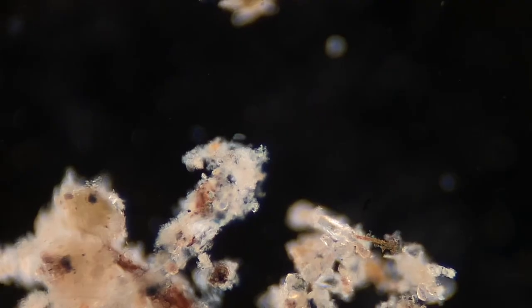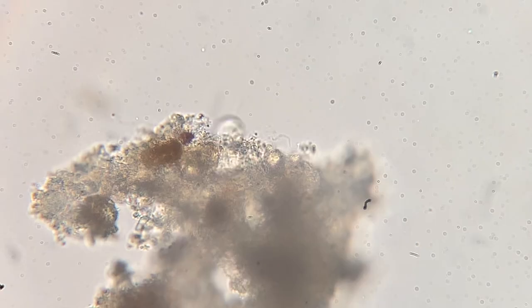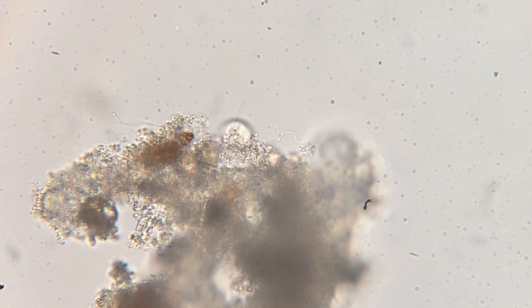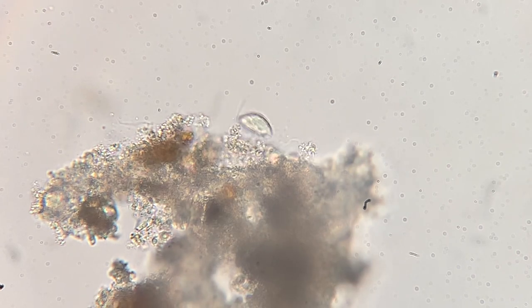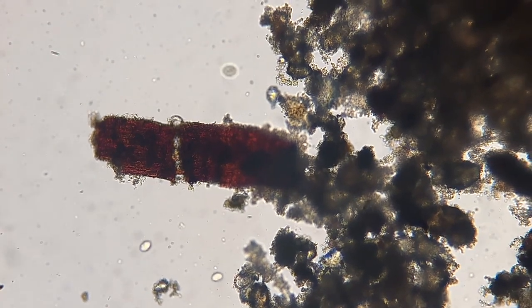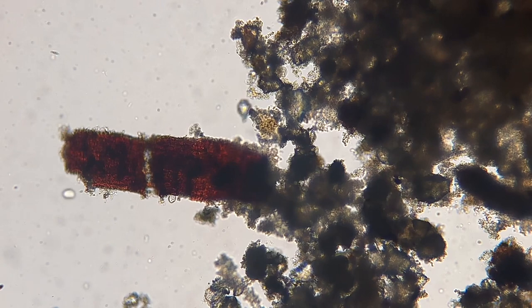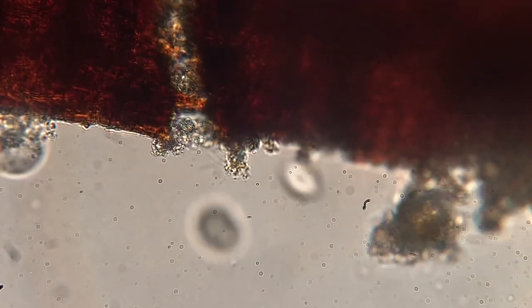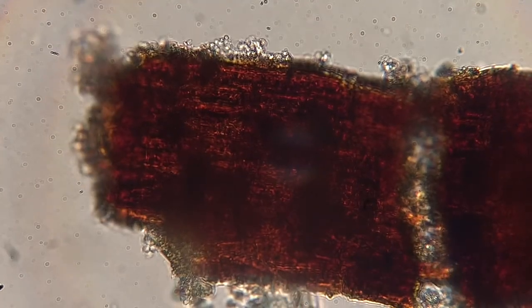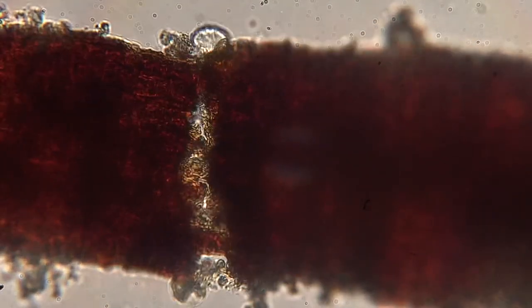Let's go ahead and look at some things that are a little bit smaller. These guys are probably in the same family or group as the spirotrichs — they might even be a different subspecies. They have a very similar shape, and most of their cilia are underneath their body, which they use to swim but also crawl around. There were a bunch of them that I found on what looks like a small dead piece of grass, so I decided to zoom in. It looked like these guys were crawling inside and outside of this little blade of grass, and it also seemed like there was some fungus growing on it. There's another species traveling by rain.